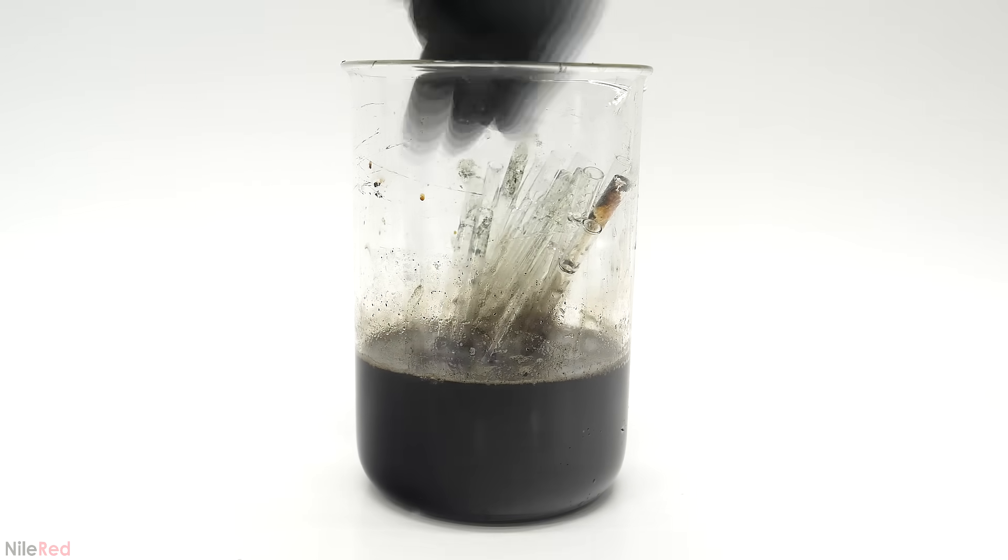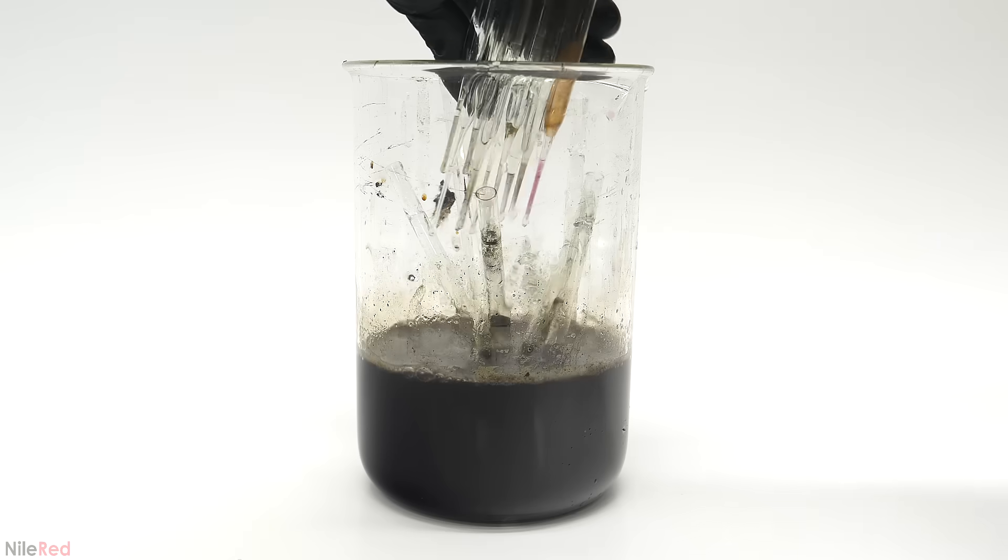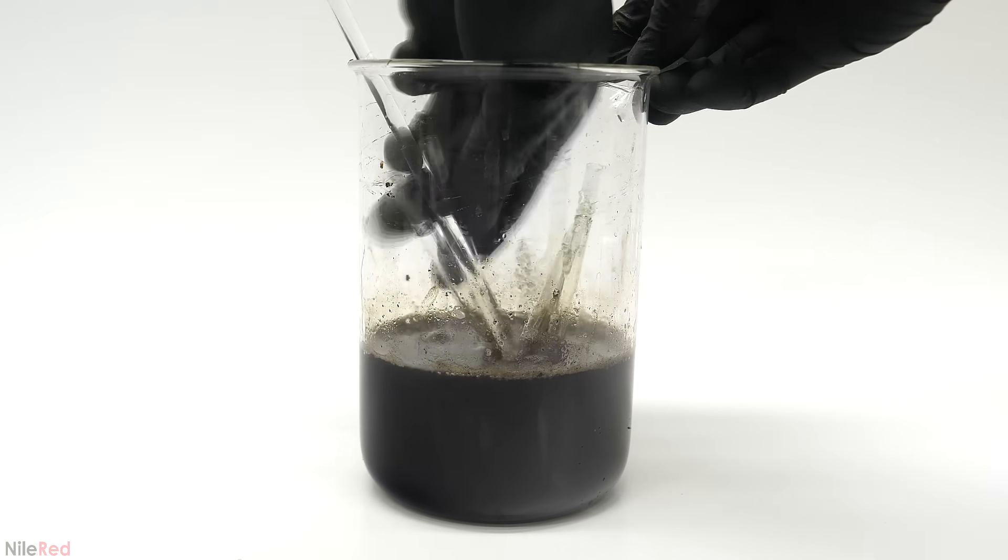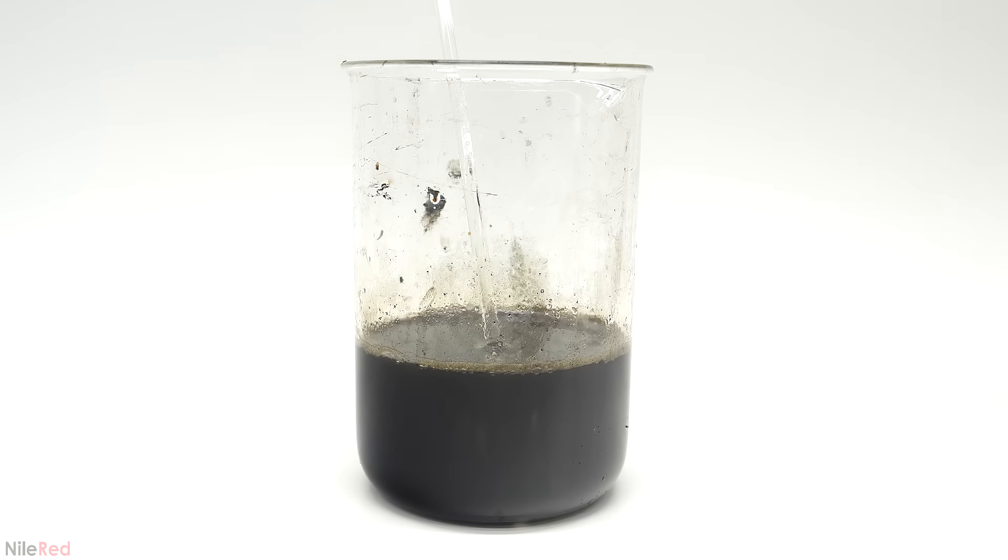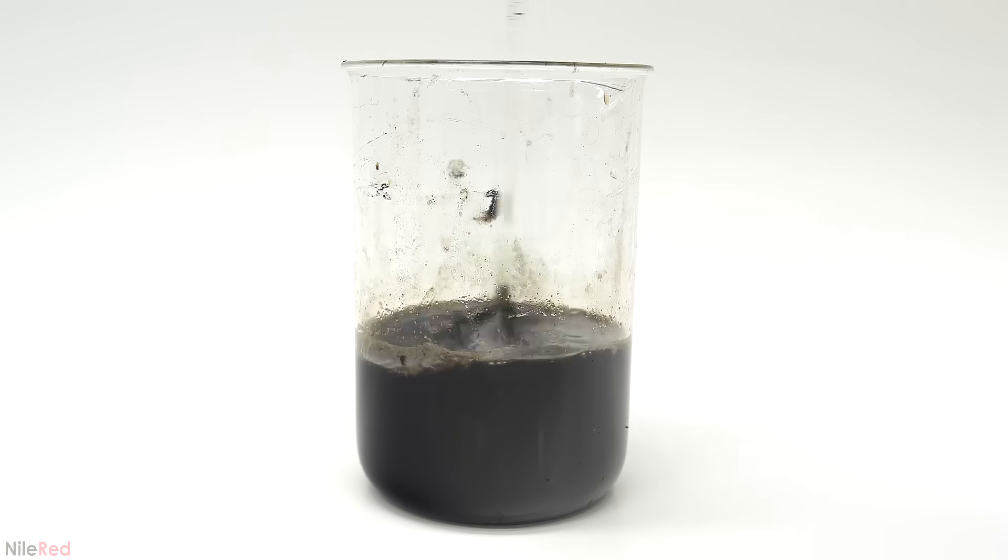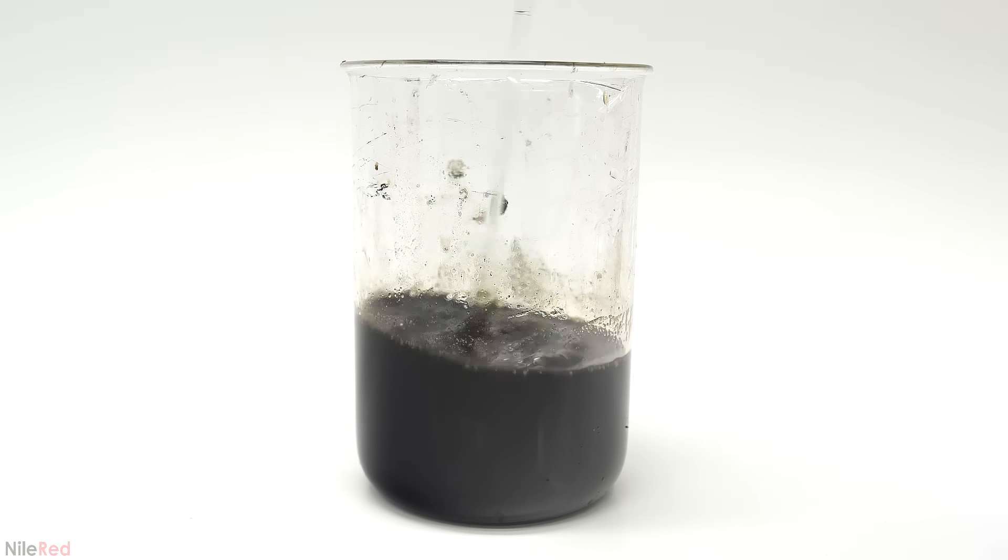I let this react for about an hour, and then I started taking out the pipettes. I washed them as best as I could with water and tossed all of them into my glass waste box. This was all still very acidic because of the sulfuric acid, and I now had to neutralize it. This was done by just pouring in a concentrated solution of sodium hydroxide drain cleaner.